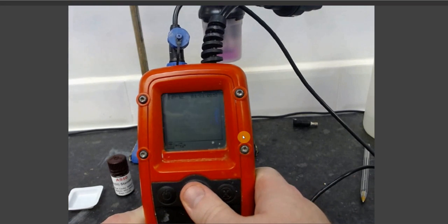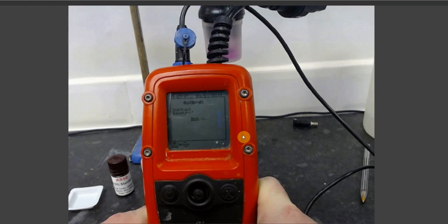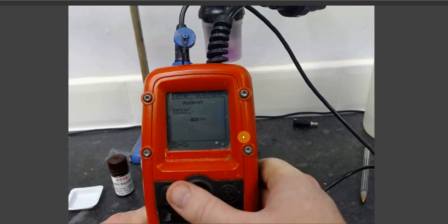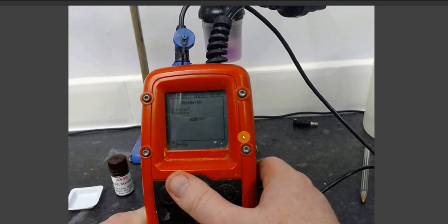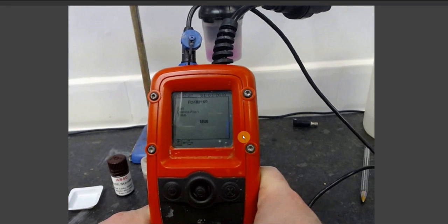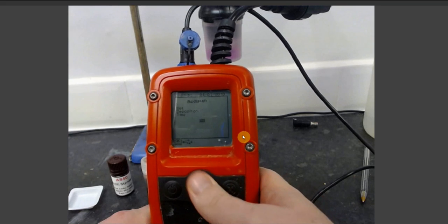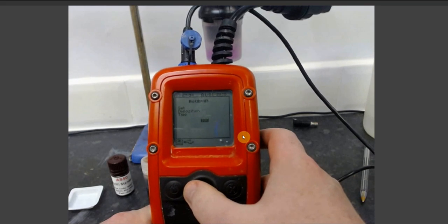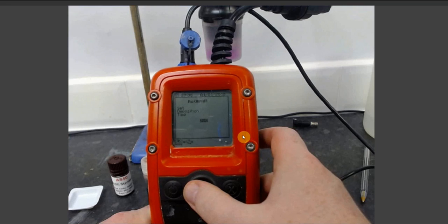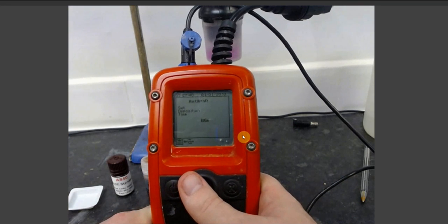As such, simply press select and it will take you to the next prompt, which will ask you if you wish to subtract baseline. For arsenic total, press select on yes. It will then prompt you for a deposition time. You can alter your deposition time by pressing sideways on the controls for the Metalyser unit.